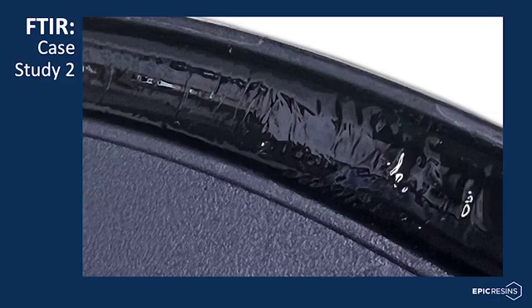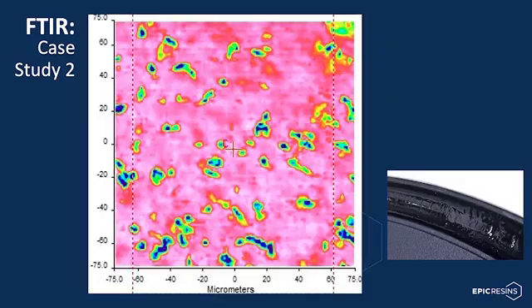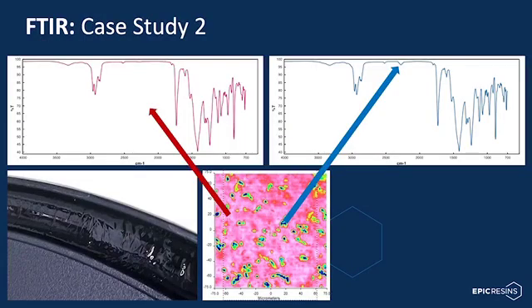We again started this analysis by sectioning the potting compound in the suspect areas. Upon analysis, the following ATR microscope absorbance pattern was produced. You will probably notice the significant color variation in this example compared to the first example. This is because the ATR microscope uses color variation to visually show where there are significant variations in the FTIR spectrum. If we look at the spectrum of the pink areas, you can see at 2275 inverse centimeters, the absorbance is minimal. However, the spectrum of the blue dots show a distinct peak in this region.